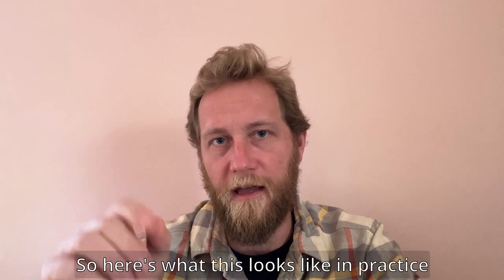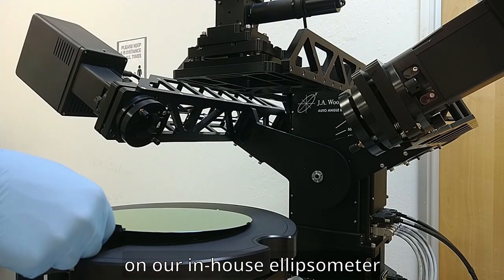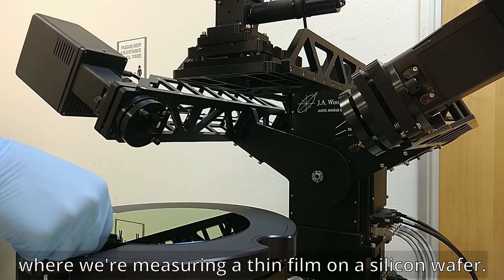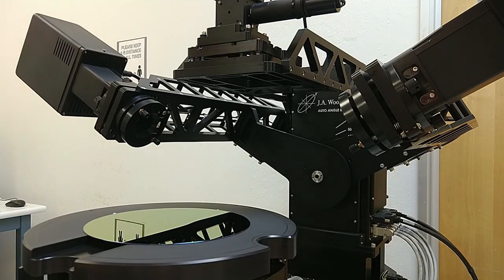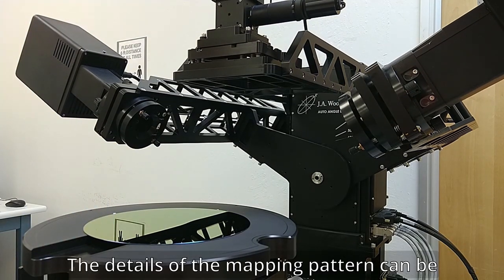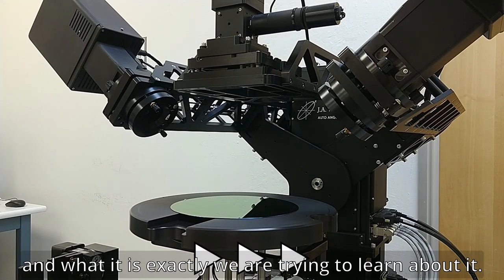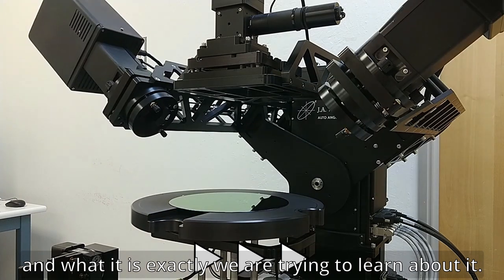Here's what this looks like in practice on our in-house ellipsometer, where we're measuring a thin film on a silicon wafer. The details of the mapping pattern can be entirely customized to the sample size and exactly what it is we're trying to learn about it.